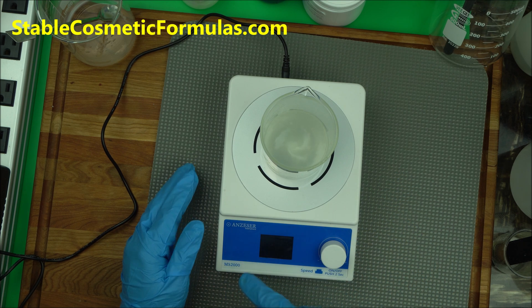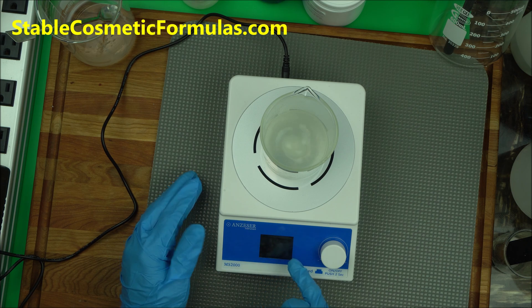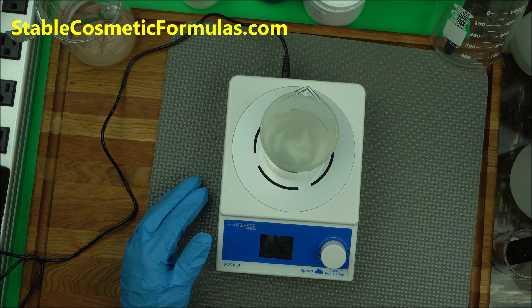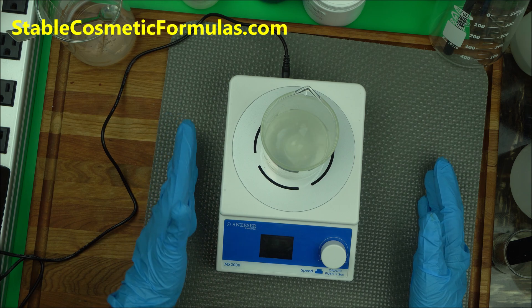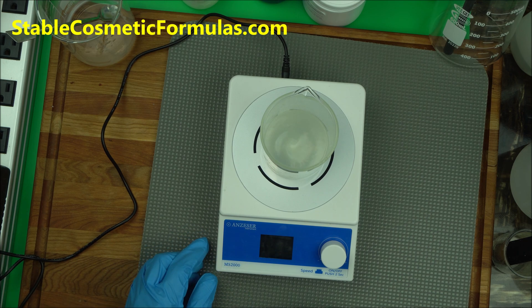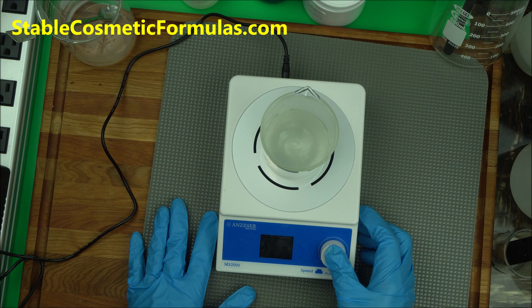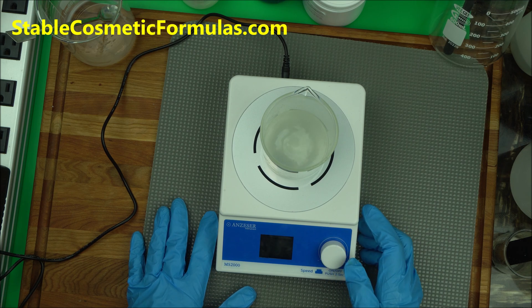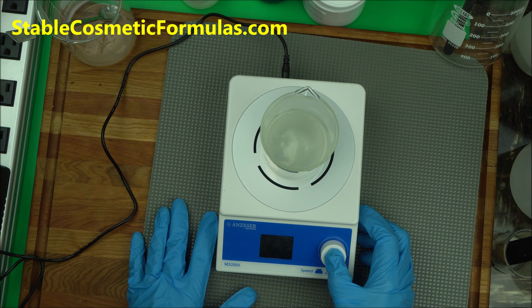The good thing about this magnetic stirrer is it has a digital display where you can see your rpm, you can monitor the time. You can just do other stuff while you are monitoring it. Please don't leave it unattended, just let it do work and monitor the time. When the time is over, it's going to stop by itself.